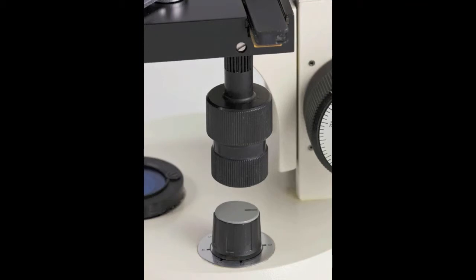Once the slide is in the slide holder, use the mechanical stage knobs to move the slide into position over the condenser and to move the slide around when searching for objects.